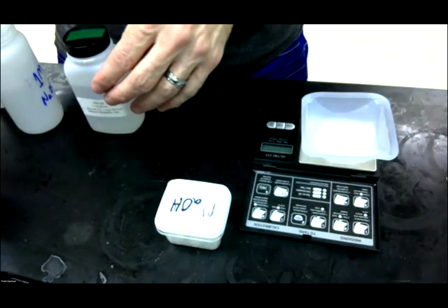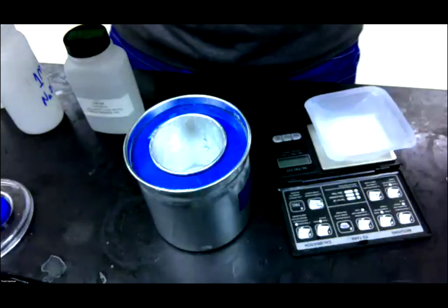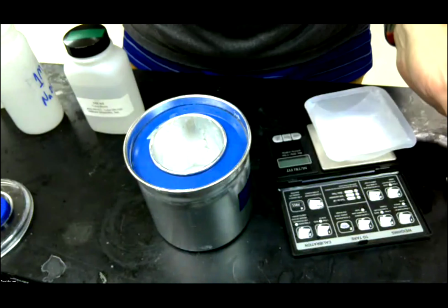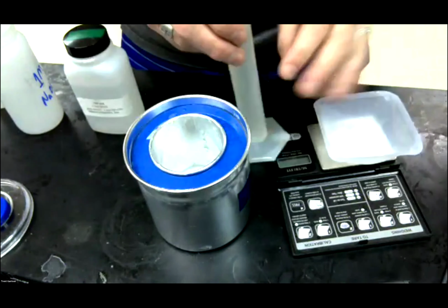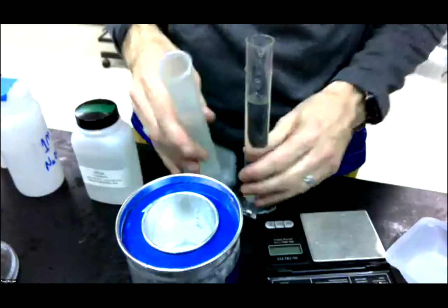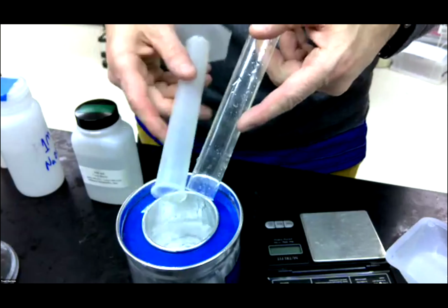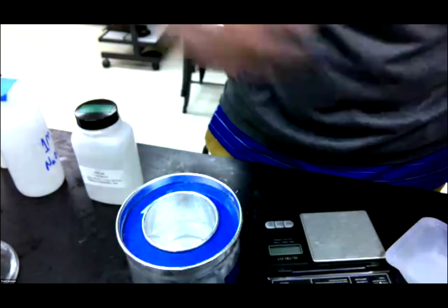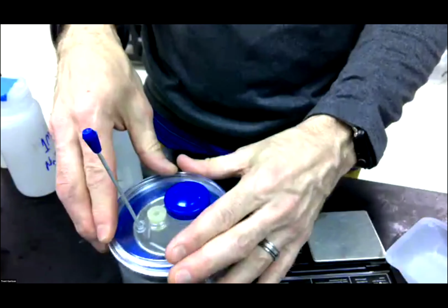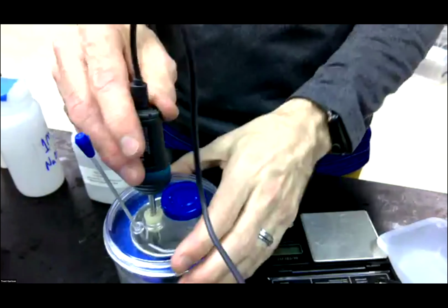So if we follow those instructions, we're going to start with our calorimeter. We have used this before. And what we're going to add to that is 100 milliliters of water. I have pre-measured that 100 milliliters of water in these 2 containers. So we're going to pour those into our calorimeter. It was empty before. We've got 100 milliliters of water in there. That is just basically room temperature water. I'm going to put my lid on here, and I am going to then insert my thermometer in here.